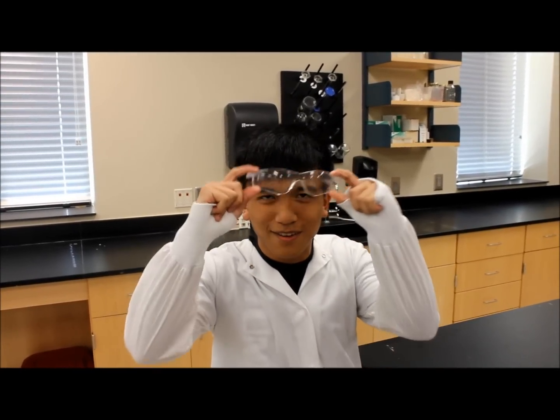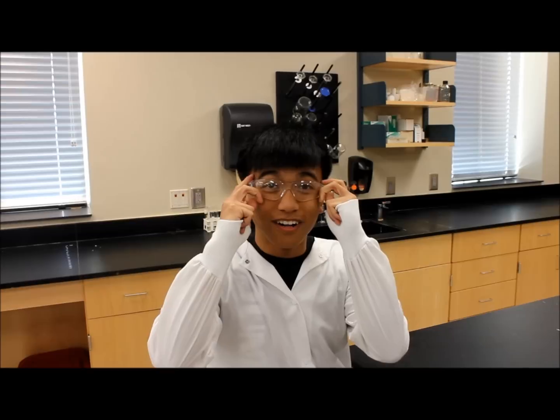Okay, so just to let our audience know, in the lab, there are certain safety procedures you must follow. Since you're an expert, since you've been to the lab countless numbers of times, what safety procedures must you follow in the lab in order to not kill yourself? First of all, wear goggles. Second of all, you have to wear a lab coat, which will protect you from dangerous things and from getting you killed. What kind of dangerous things would be in the lab that could possibly kill you? Fire, explosions, deadly smoke, and crazy lab partners.